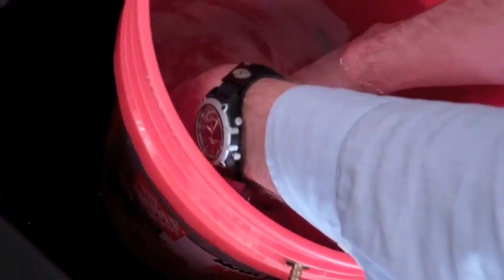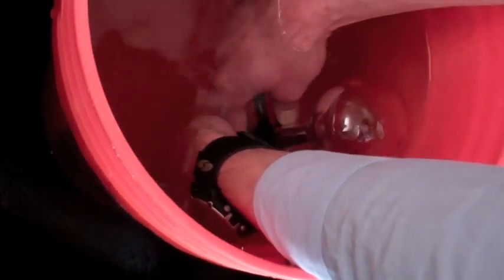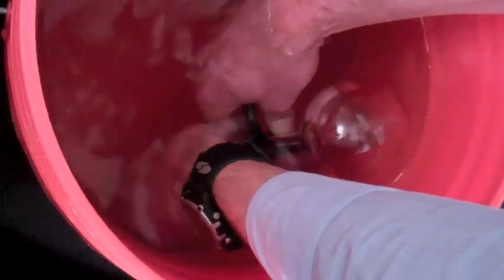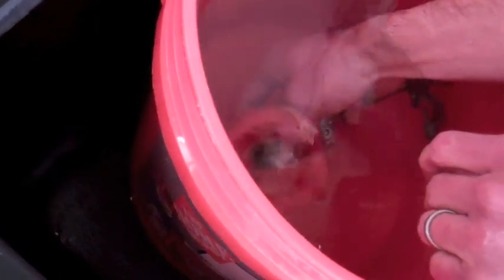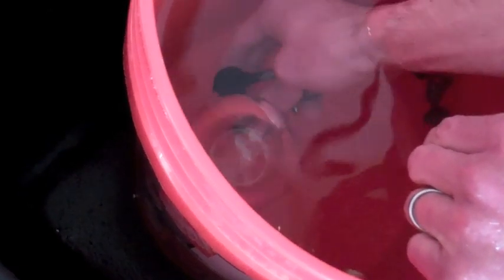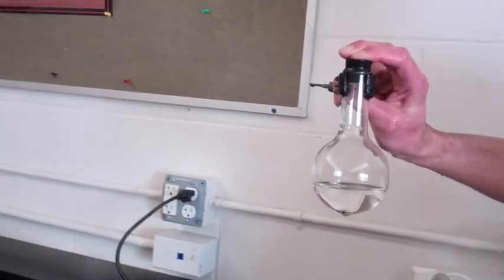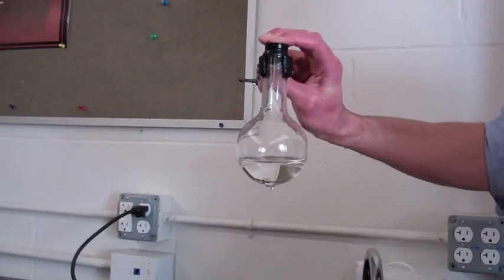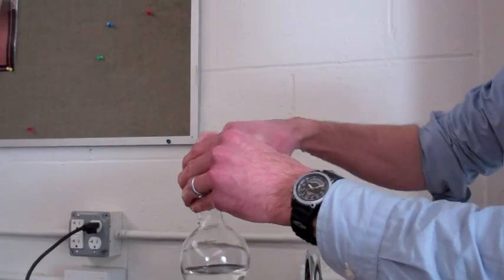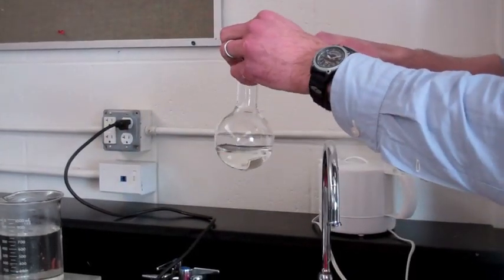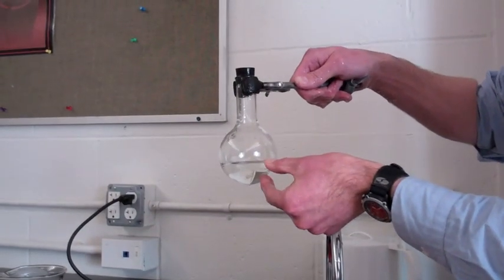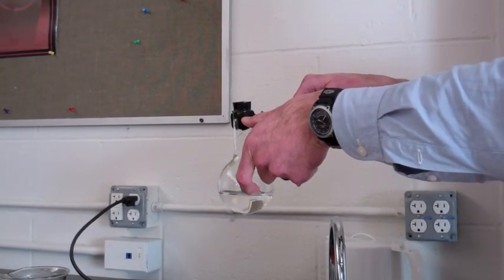Assume that this is at equilibrium, and I'm going to go ahead and pull out the stopper. I just grab down here, give it a little wiggle, and you can see a bunch of water came into the flask. I wait for a moment just to make sure that's there, and I'm going to put my finger over the stopper so that no air bubbles escape, because I want the number of air particles in there to stay the same. Wow! Water went in? What's happened to the volume of air inside that flask? Looks like the volume of air has gone down.